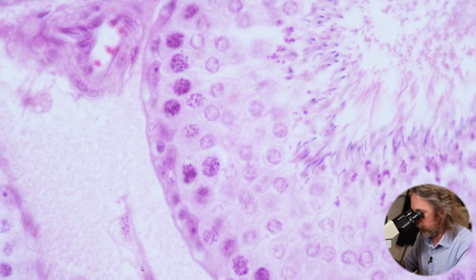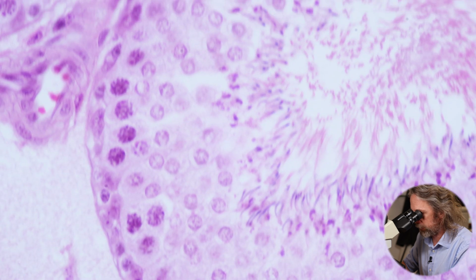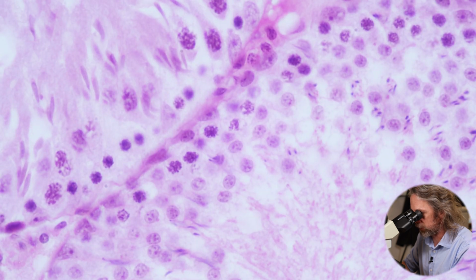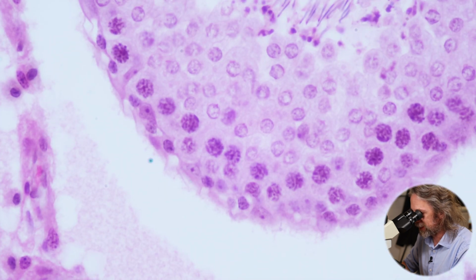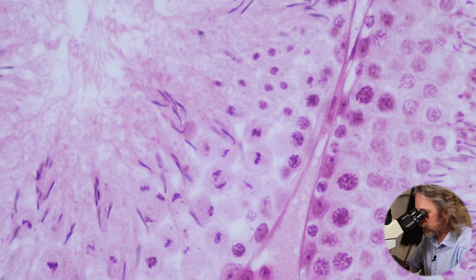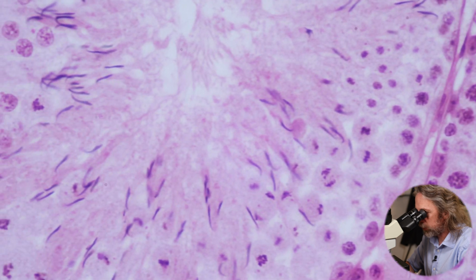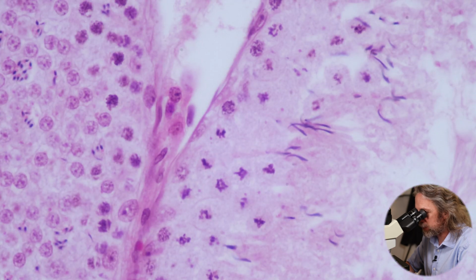And then actually, we can see, if we move around, so if we now know that the purple is DNA, and if you've ever looked at the stages of meiosis and mitosis in a textbook, cell division, and you've seen the DNA getting moved around in the cell as the cell gets divided, we can actually see that happening in some of these cells. Yeah, look, in those cells in there, in the secondary spermatocytes, you can see the very dark purple DNA getting pulled to either side of the cell, just as we see happening in the textbooks.